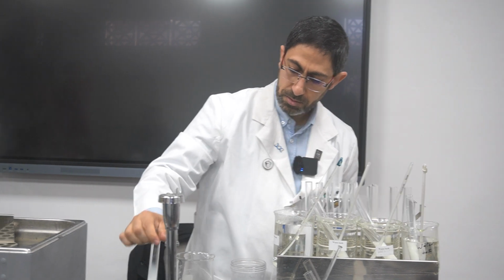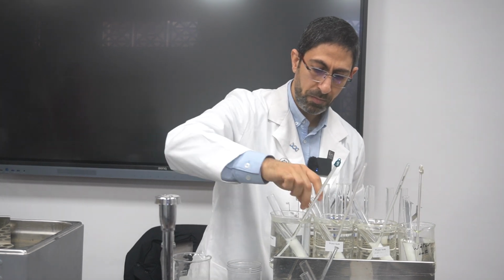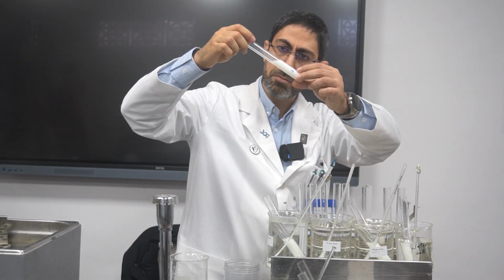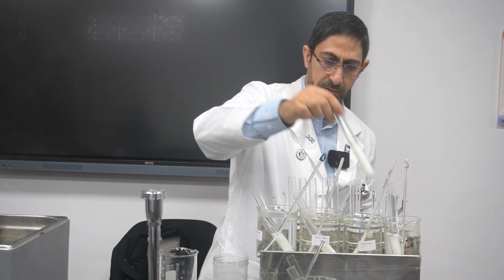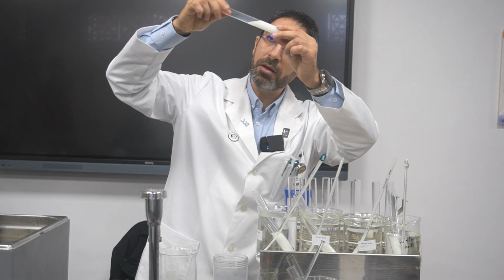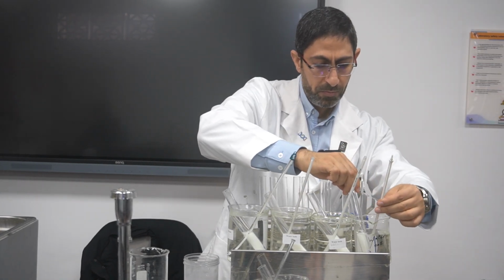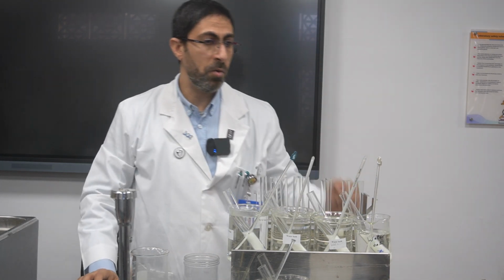Here is 80 degrees Celsius. No reaction. Here is the 60 degrees Celsius. No reaction yet. Here is the 40 degrees Celsius. Yeah, it just started. Okay, we still have time. Here is 30. Just put it. Okay. Each one, please, with its own stopwatch.